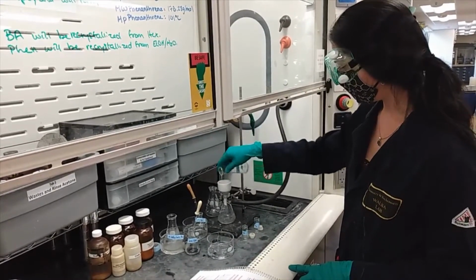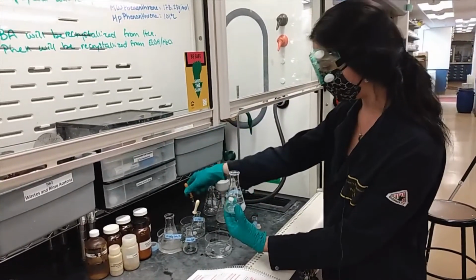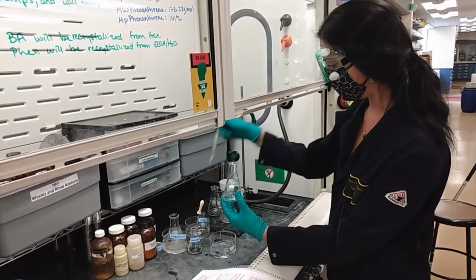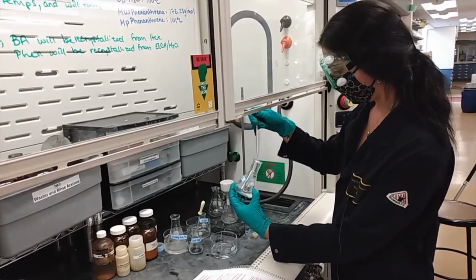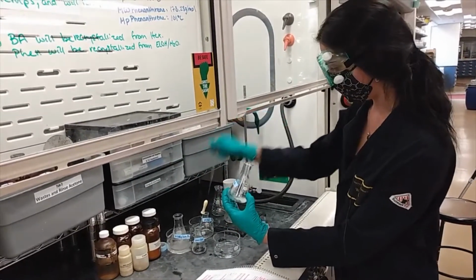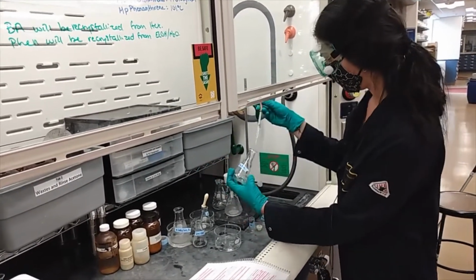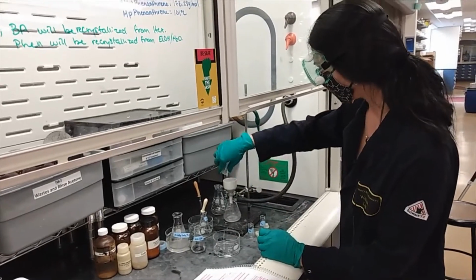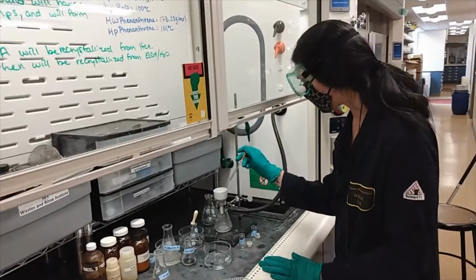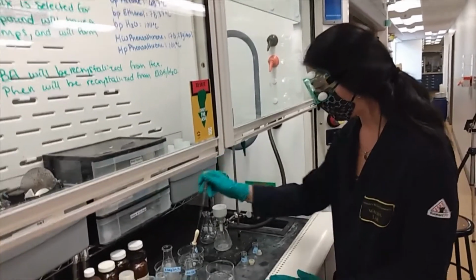Now you'll notice that some of your crystals will stay in the flask, and in order to extract those crystals, take a few milliliters of your chilled hexane solution, pour it around the rim of the flask here. And you can rinse your crystals that are on the filter paper with some chilled hexane just to ensure that you dissolve all of those impurities thoroughly.